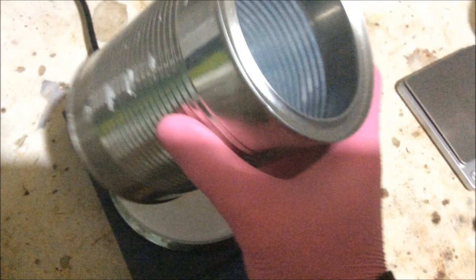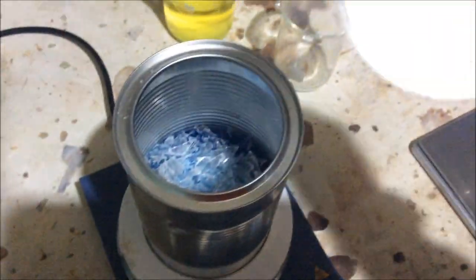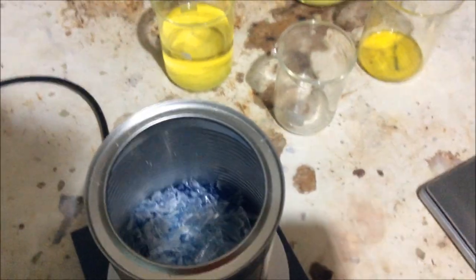The blue ethylene glycol is in there. There's not heaps of excess solvent. I have a feeling it's going to take a very long time to heat up. So during this time we're going to be cutting the hole out of the lid.